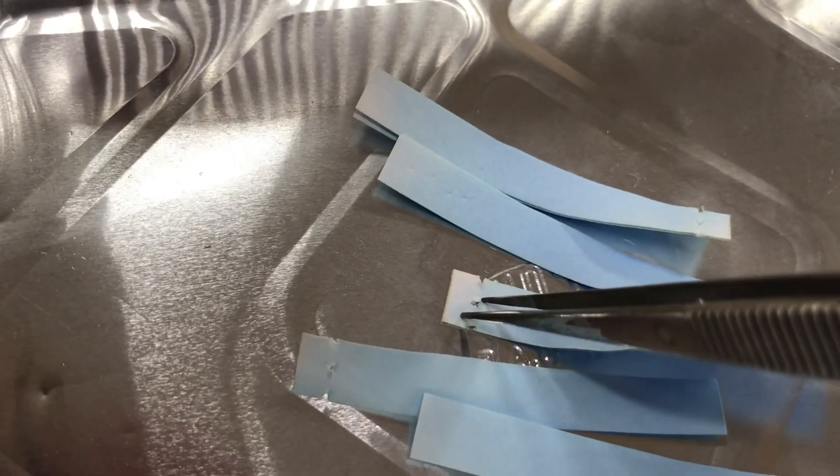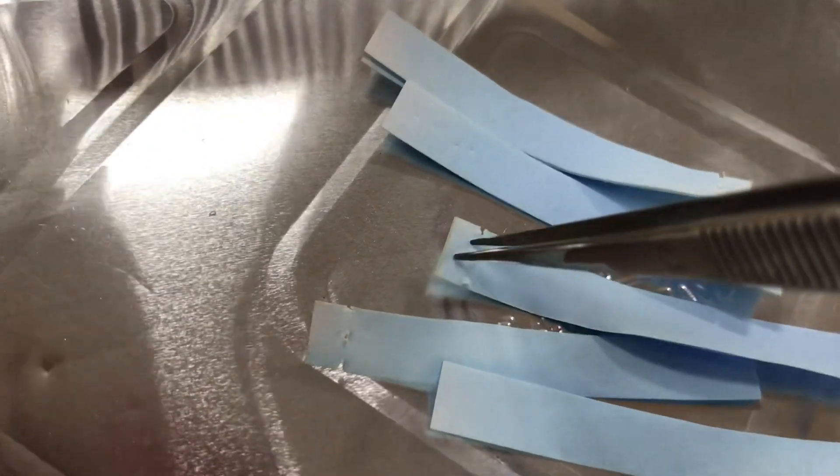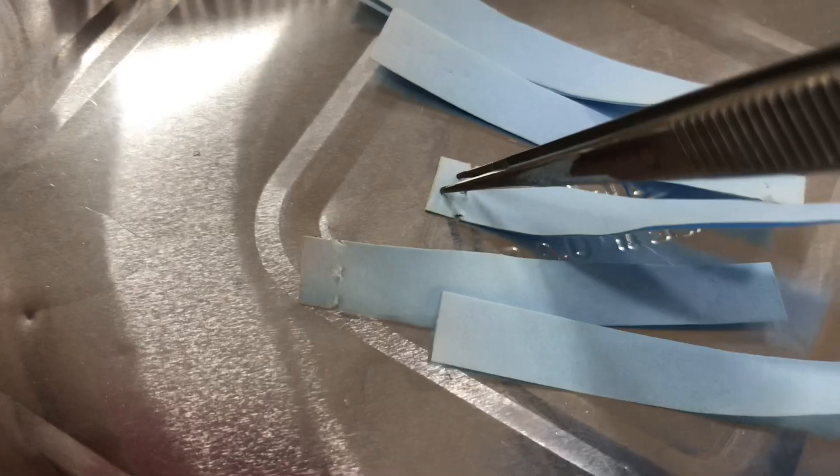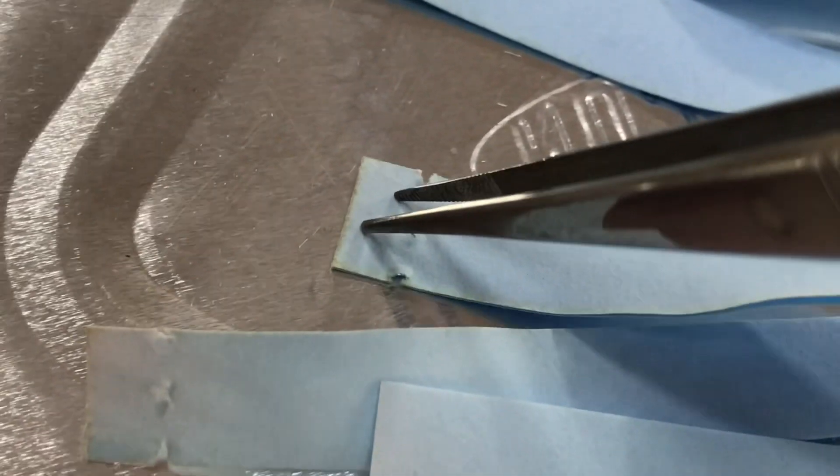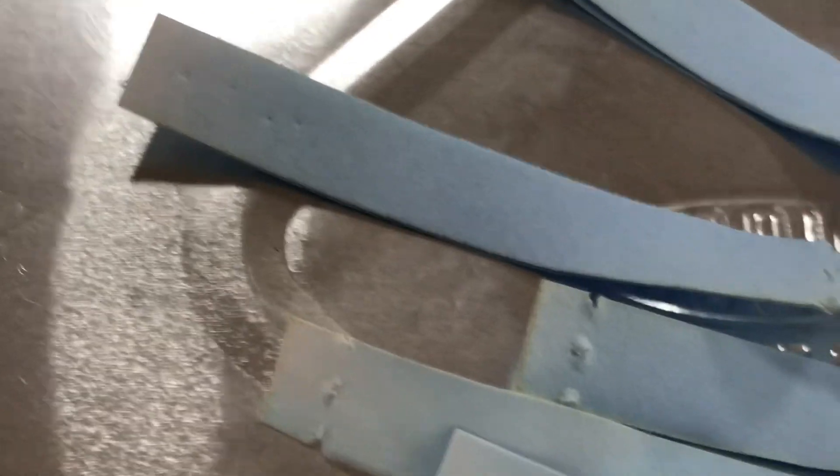This doesn't tell you if you've got pure water. It actually highlights the presence of water. Okay, so what I'm going to do is move one of these over to a white tile. I've got a white tile over here.